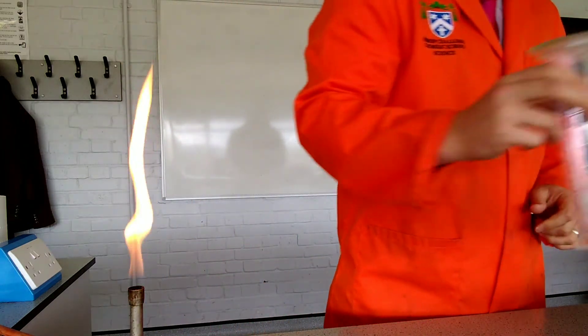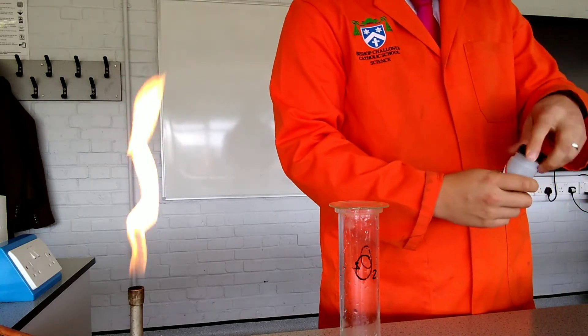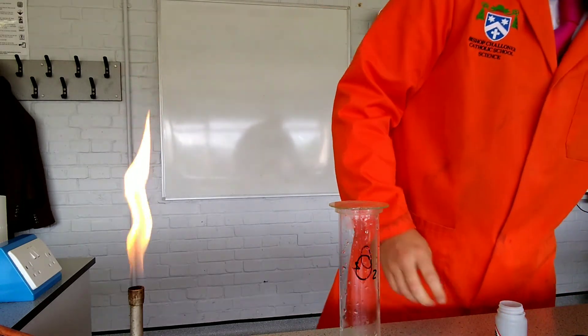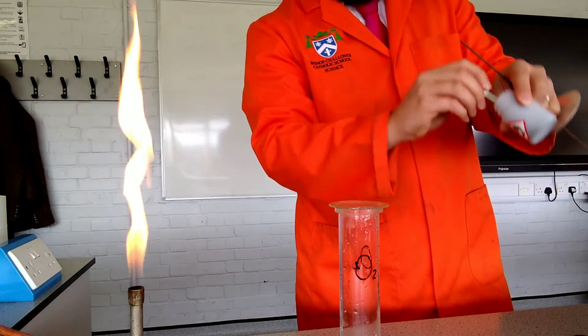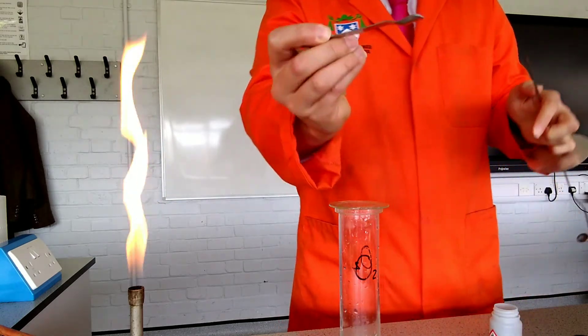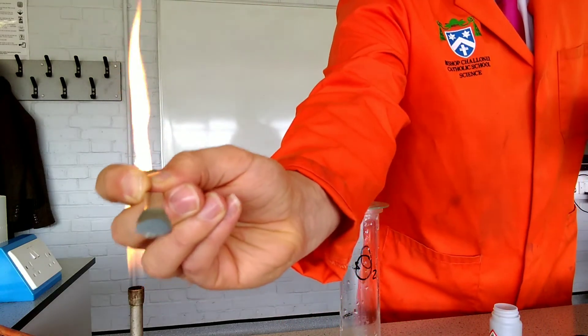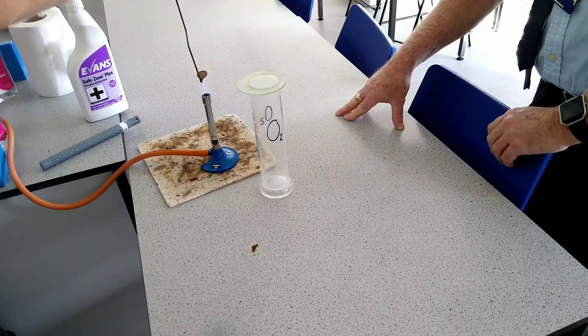Right, next up, I've got another gas jar of oxygen and this time I'm going to use zinc metal and another deflagrating spoon. So zinc is a grey powder. You can see that there.